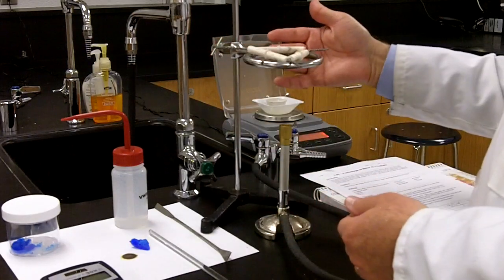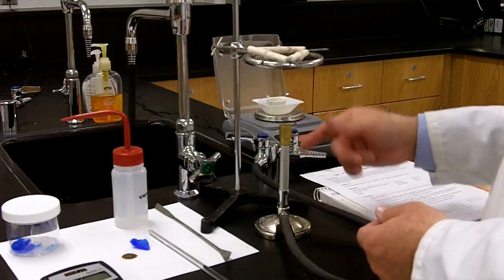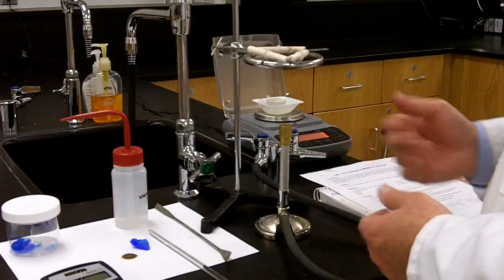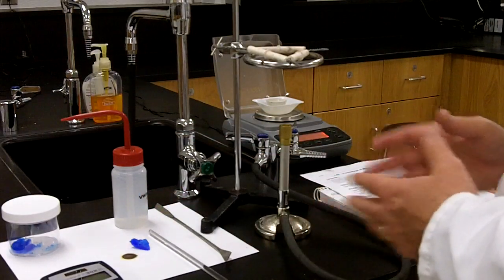By the way, the ring clamp should be about two or three inches, three and a half inches at the most, away from the exit from the flame of your Bunsen burner. There shouldn't be any obstructions. Everything should be out of the way as you start the flame.